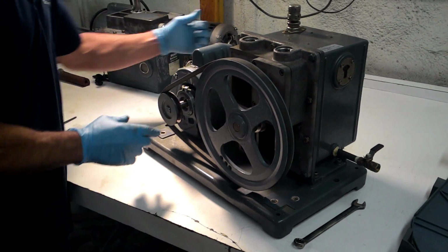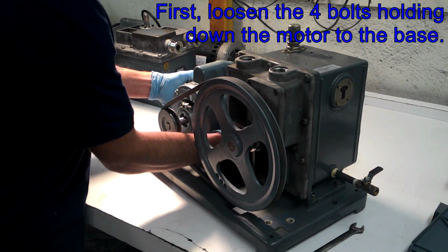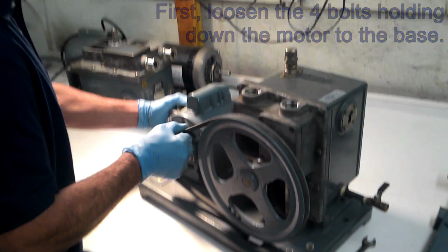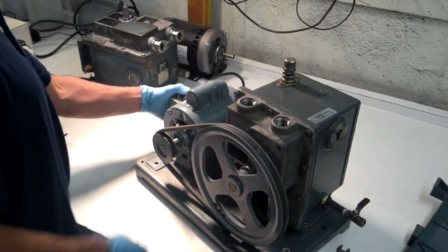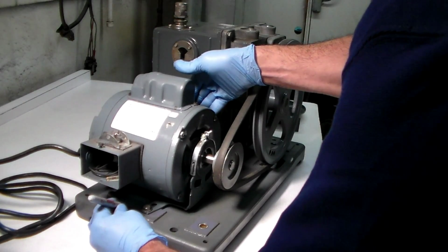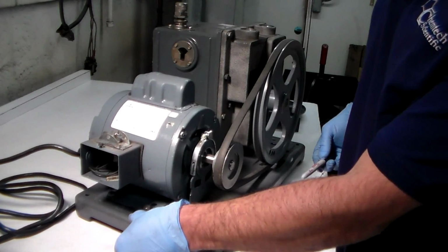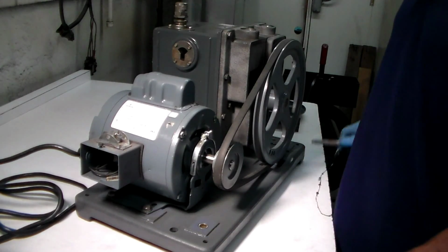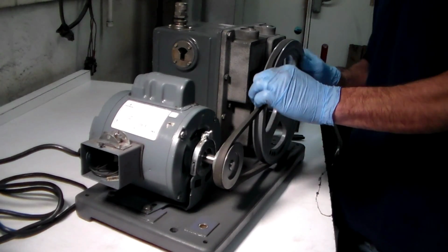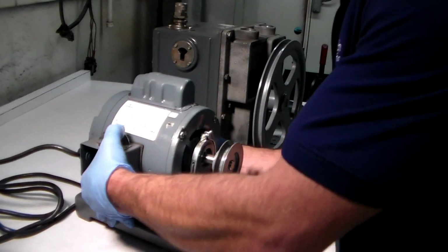I will show you. What I do is I pull the motor back, okay, so that I can tighten it up a little bit. And what I do is I take a magic marker and I scribe where my motor is back here. Okay? I put a mark where the motor is going to go. Then what I do is I take my pulley and I take my belt off again, okay?